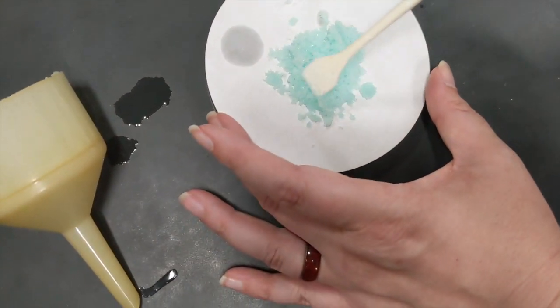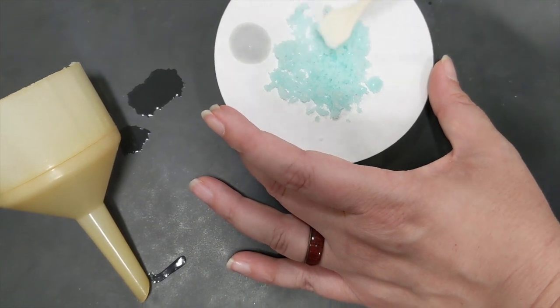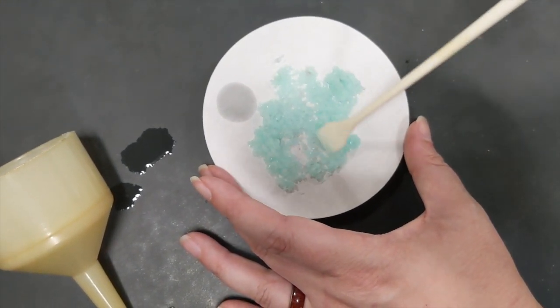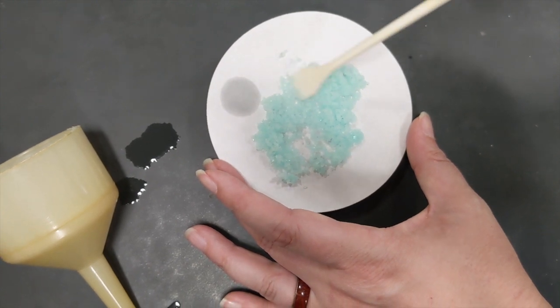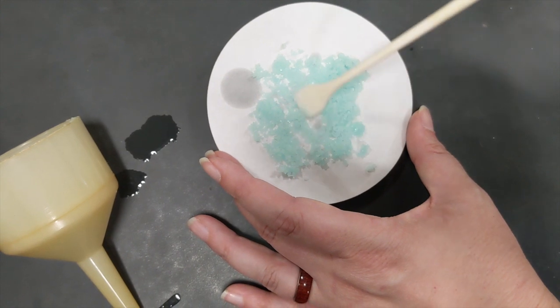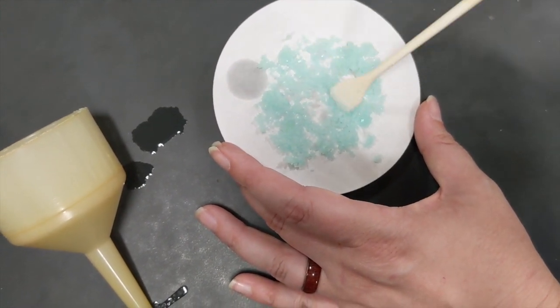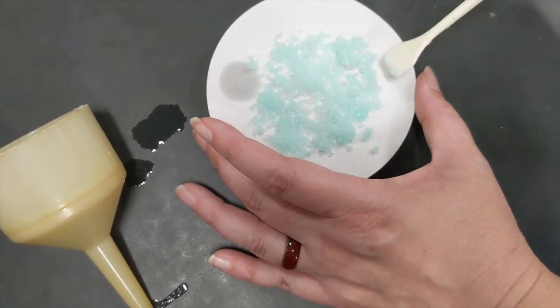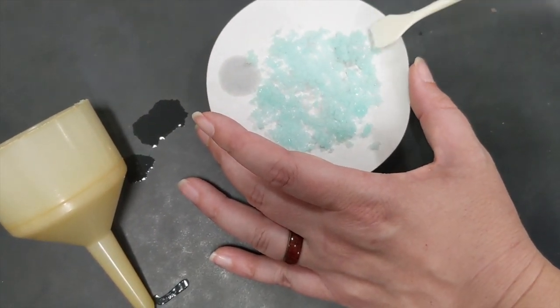So I'll spread the crystals out a little bit to help make it easier for them to dry. You can tell from the way the filter paper is darker here that they weren't completely dry when I put them down. So I'm not even going to bother to get a final weight today. We'll wait until tomorrow when they'll actually be dry because all of this ethanol will have had a chance to evaporate.